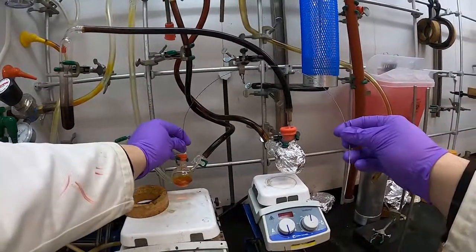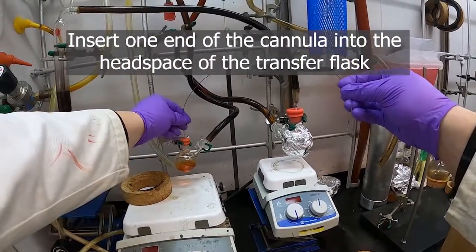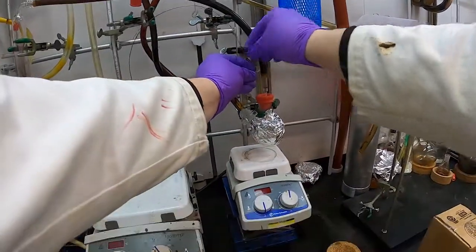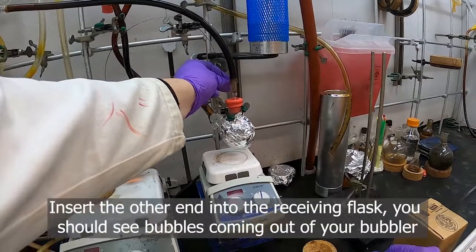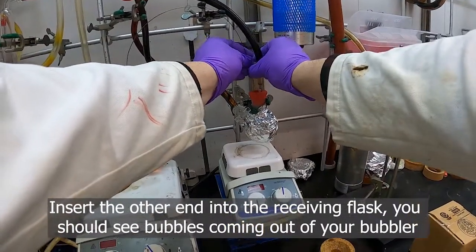We'll take our cannula and insert it into this through the septum, but not into the solution yet. And now we'll insert this over here into our flask here.